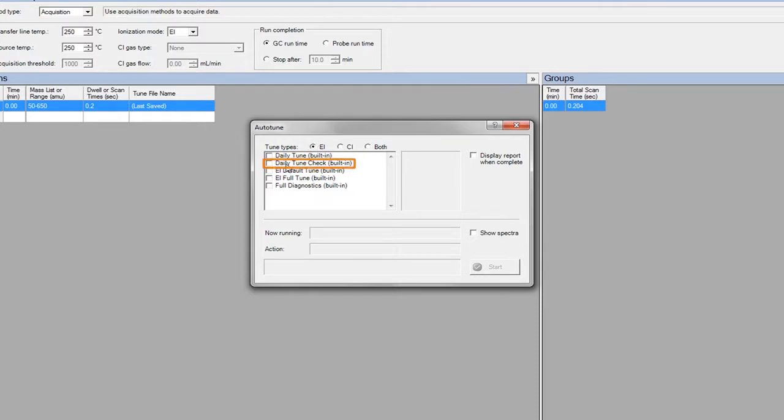The daily tune check is a quick system status check. If the system does not pass the daily tune check, then run the daily tune. If the system cannot pass the daily tune, it is time to remove and clean the source. After cleaning and reinstalling the clean source, run an EI default tune first, followed by an EI full tune. The EI default tune resets all parameters to factory settings, and the EI full tune completely tunes all source components.